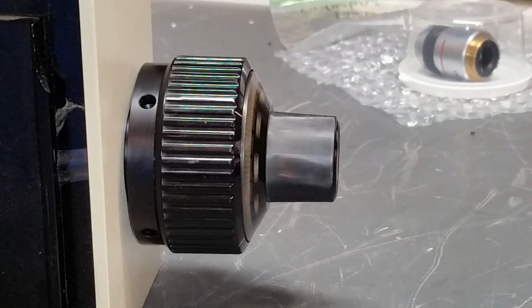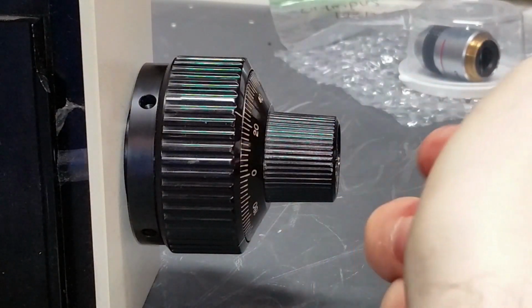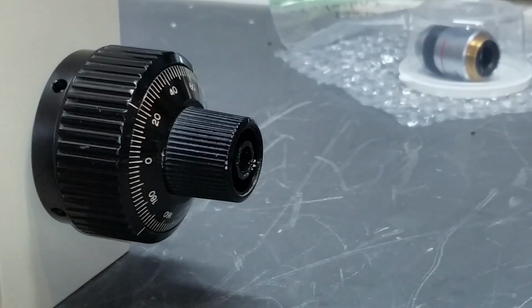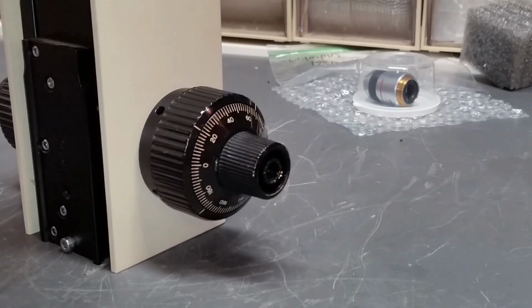Now, the way I would go about fixing this issue is, to start with, I would put a 2.5 millimeter tool in this knob, 2.5 millimeter tool on this knob, turn them against each other until one of them loosens up. And I've already done that. If you want to see how that's done, you can check my other videos, but that's already been done.